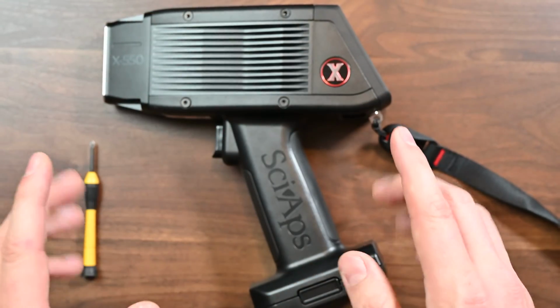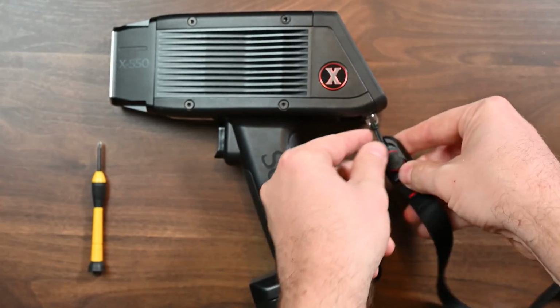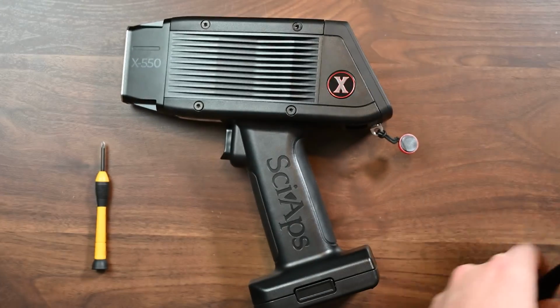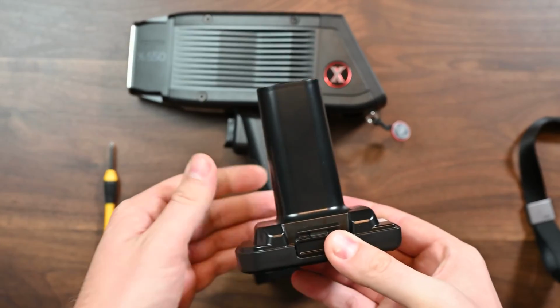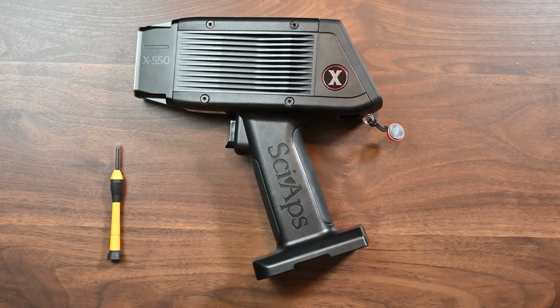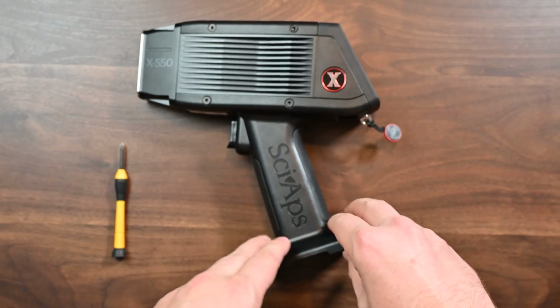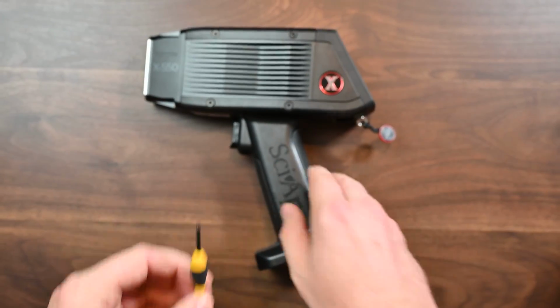So what we're going to do first is just take this unit apart a little bit. I'm going to actually take the wrist strap off. You can do that by just sliding this out. This makes things easier. Okay, set that aside. I'm going to take a battery out of the unit. I'll set that aside as well. So what that's going to do is that's going to give us access. We don't want this unit to be powered on when we're working on it, and all we're going to need is a Phillips screwdriver about the right size.